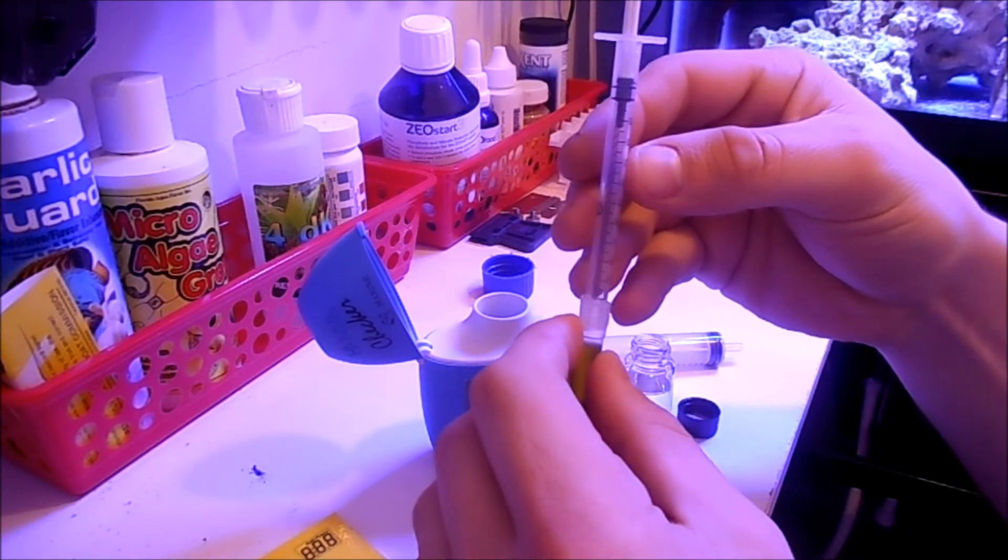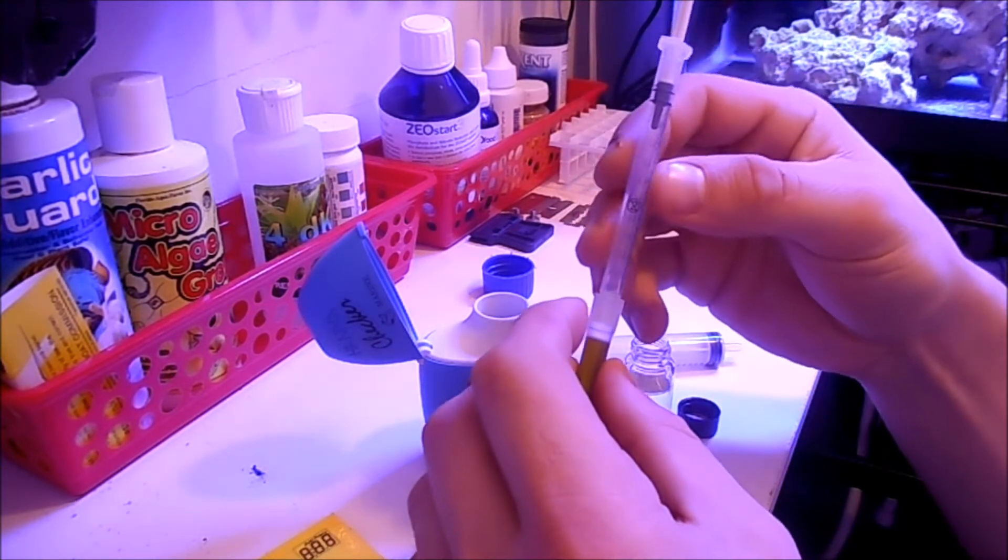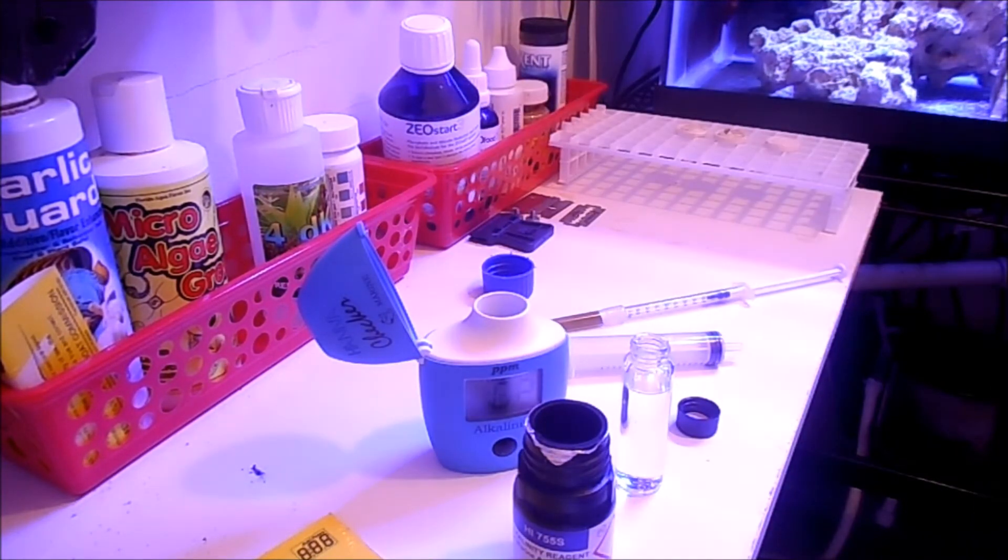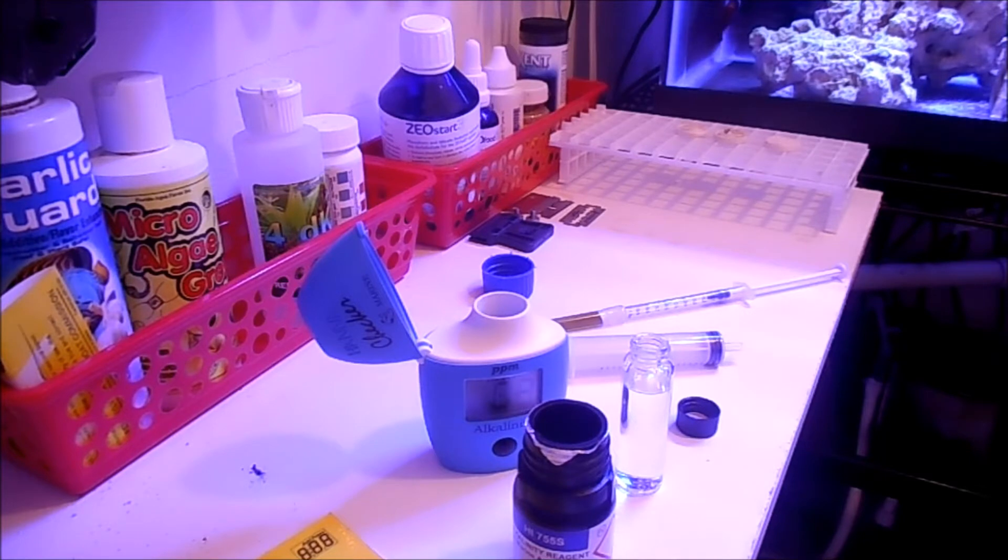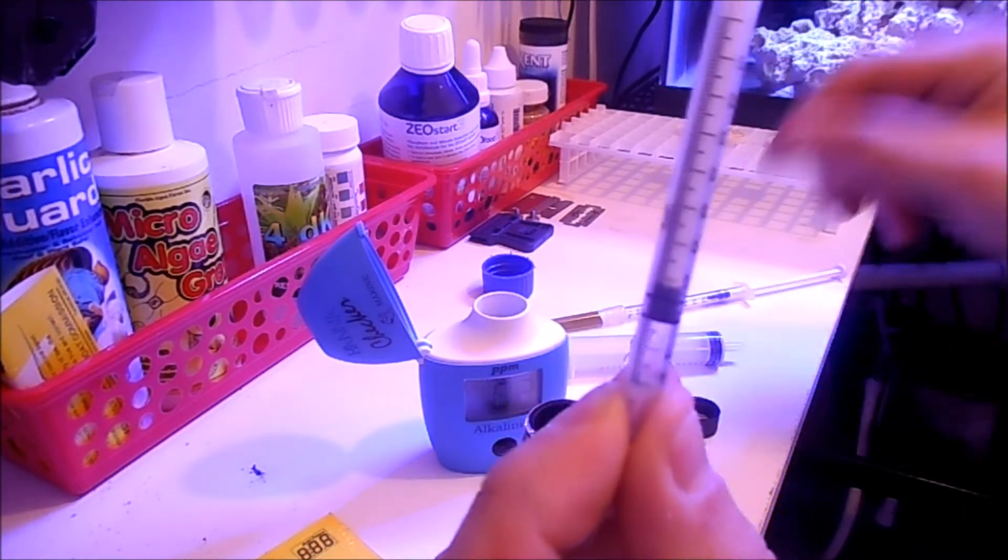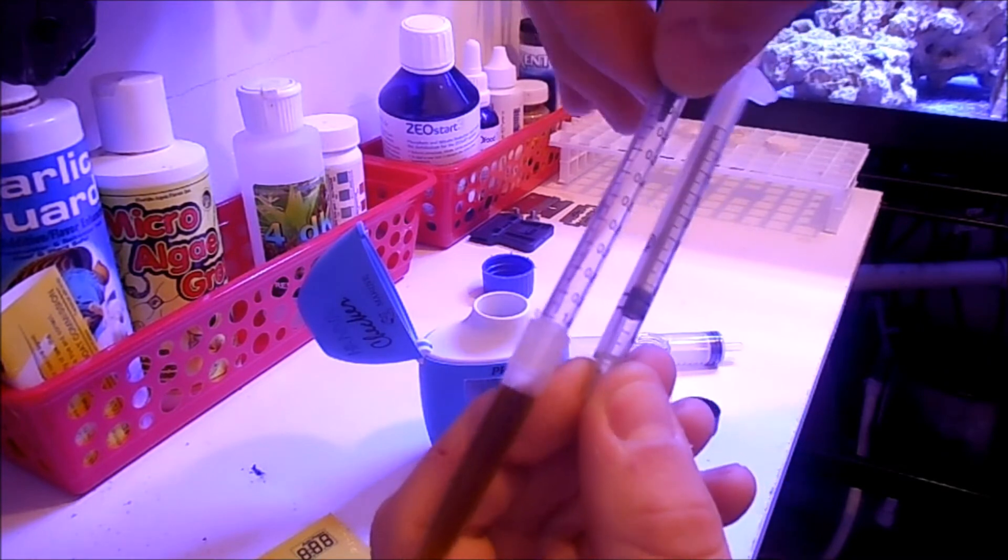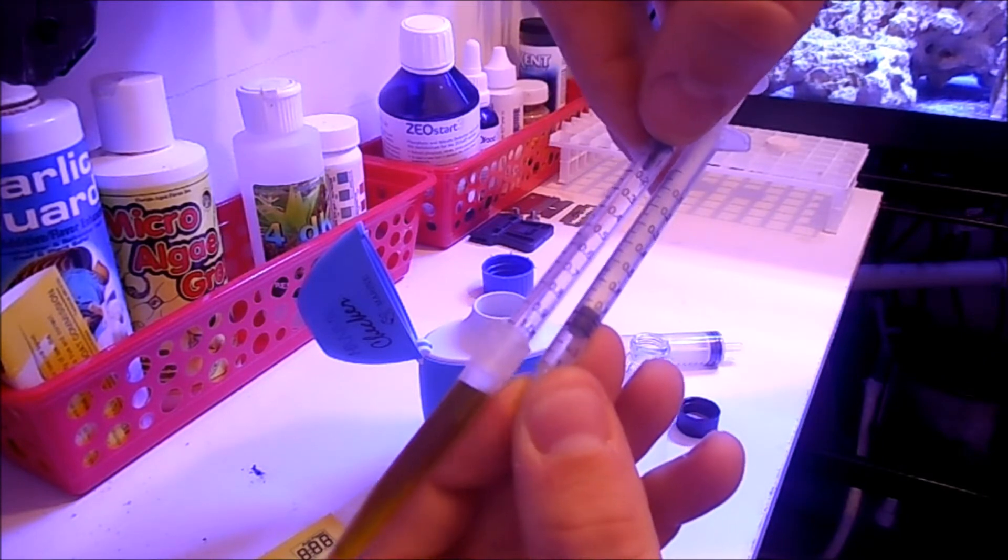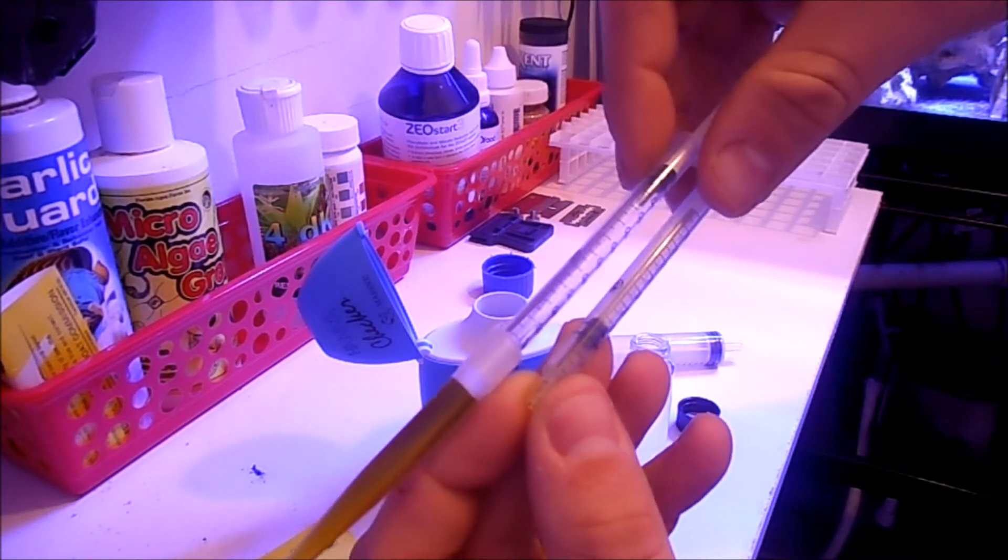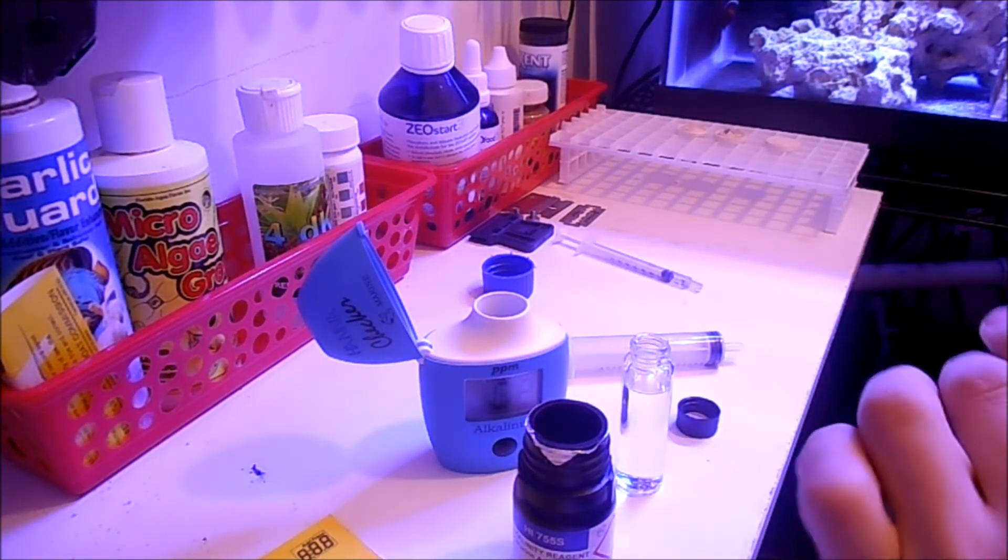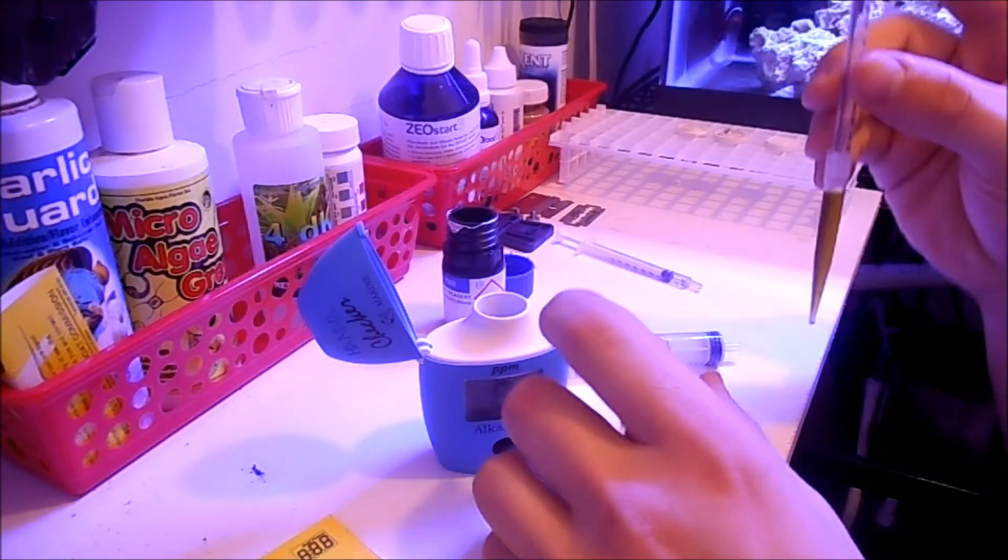Okay, make sense? This is actually a new syringe which is kind of strange, I haven't seen this one before. This is the one that originally came with it - it has the 1 milliliter. Yeah, nope, that makes sense. I'm just losing my mind thinking that it looks different. Okay, who knows. Nope, it's the same. I'm just losing my mind. All right, carry on. Set that aside. Now we're at 1ml.